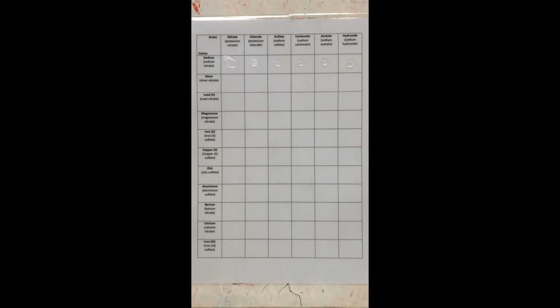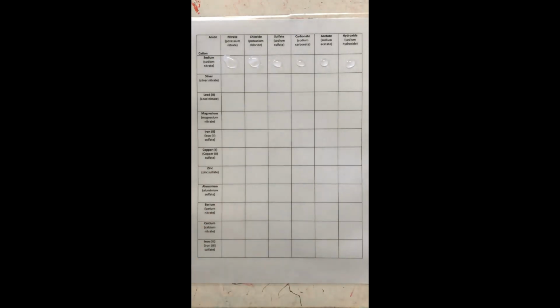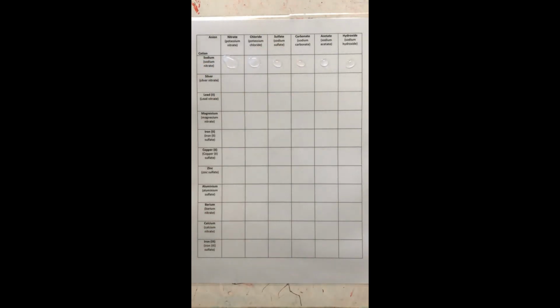All right, so what we can show there is that even though we've swapped cation and anion, we still have no insoluble compound. All right, I will try potassium chloride with it now. So what that means is we're gonna get sodium chloride as being a solution here. But guess what? We think we already know that salt and water does not make anything. All right, next one as well, we're gonna hopefully have sodium sulfate be produced. And we'll see if that is a compound we have.